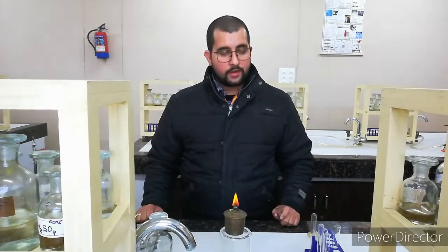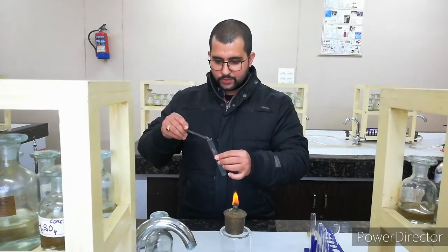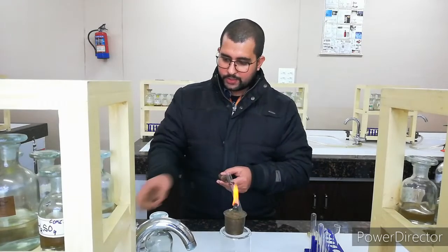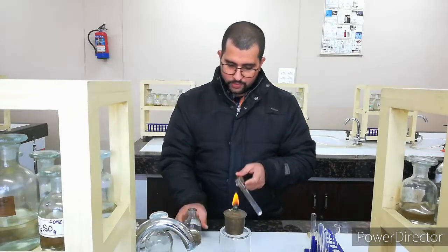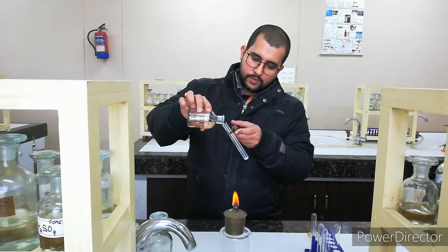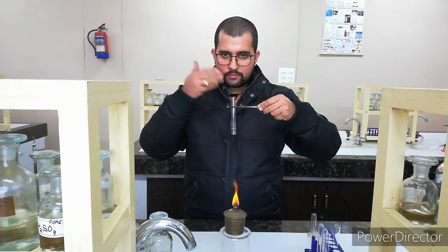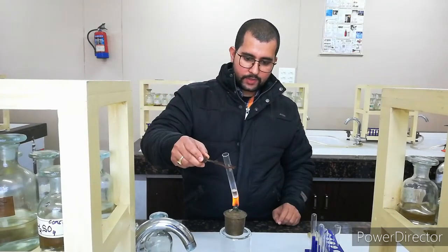concentrated H2SO4. Now we are doing the examination with the concentrated H2SO4, and I have taken again a small sample and am using a test tube holder because we are handling concentrated H2SO4. Just be careful, it is dangerous. I am adding a little bit of concentrated H2SO4 here, and we will observe whether something happens or not. I think no gas is evolving and no smell is coming. So now we will heat it a little bit and observe if something happens.